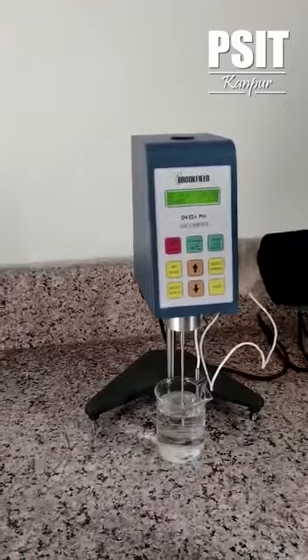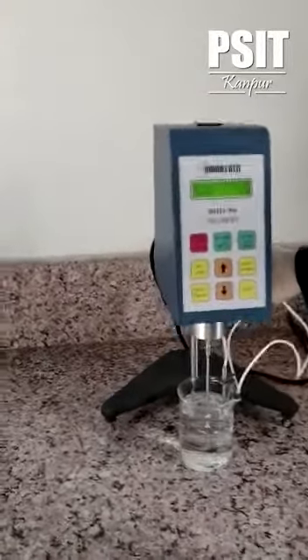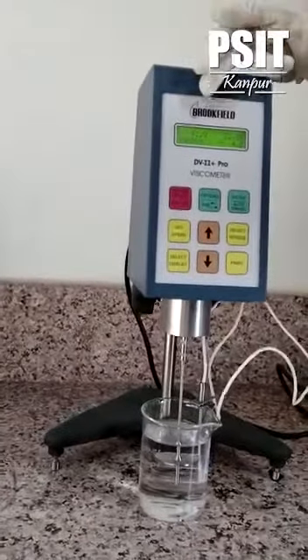By using the gear, you can move the instrument up and down into the polymer solution, and you will be having a reading of viscosity in centipoise. Thank you.